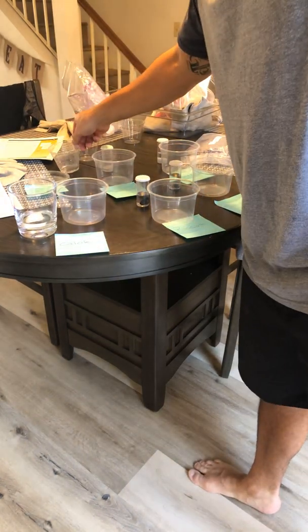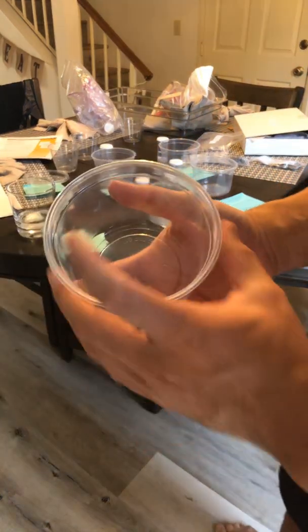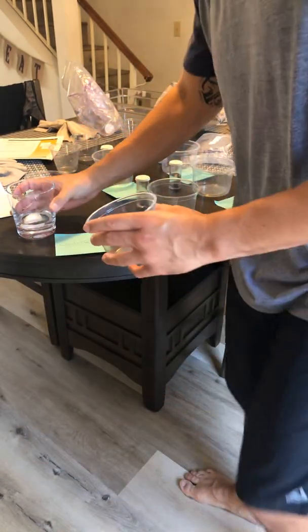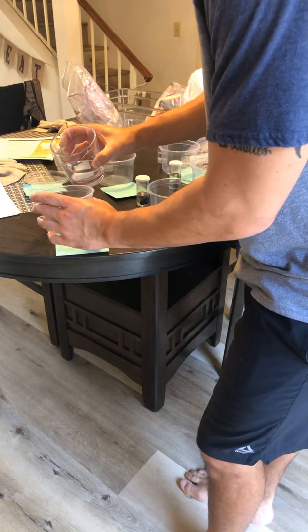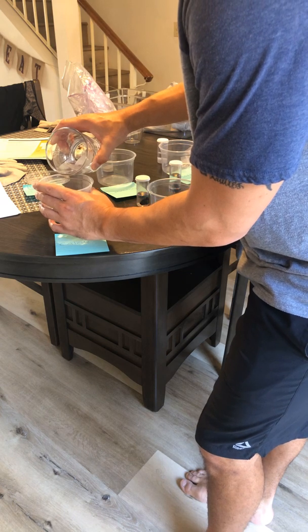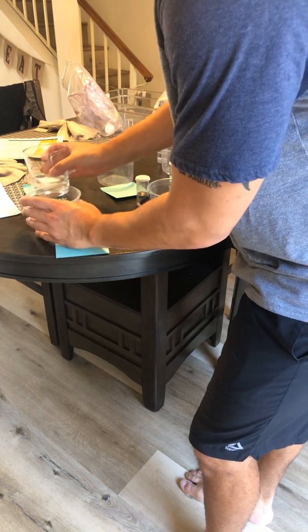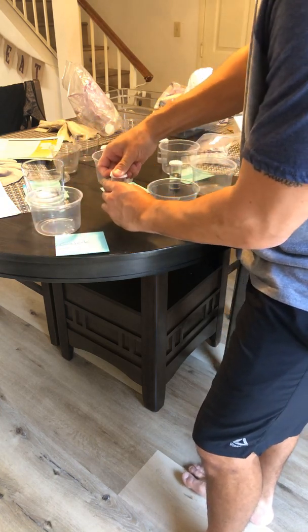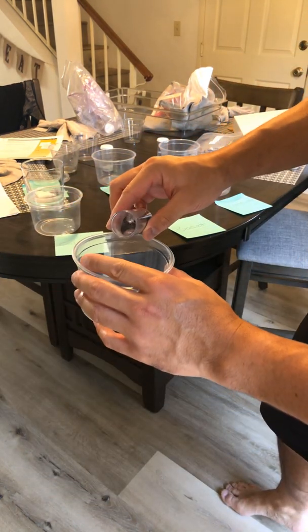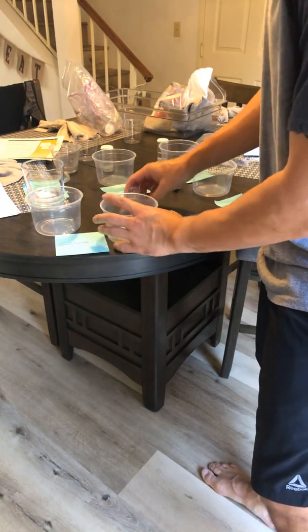So what I'm going to do is pour a little bit of each liquid in the cups. I didn't have enough evaporation dishes, but this is a wide body, so I'm only going to pour a little bit so we can see what happens when it evaporates. So this is just the calcite. I'm going to pour a little bit of the calcite in vinegar. All right, that's enough. Then I'm going to take off the lid of the basalt. This is the basalt. I'm going to pour this liquid in here.